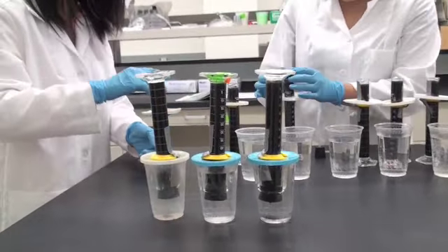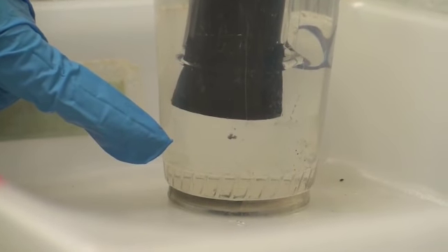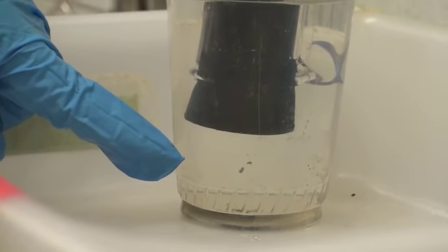Over time, the biosolids will settle, and you will notice clear liquid at the top of the cylinder and dark, settled material around the bottom of the stopper. Biogas will be produced from the decomposition, and this produced gas will force fluid out the bottom hole of the stopper.